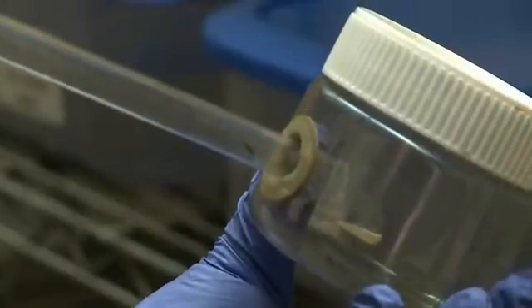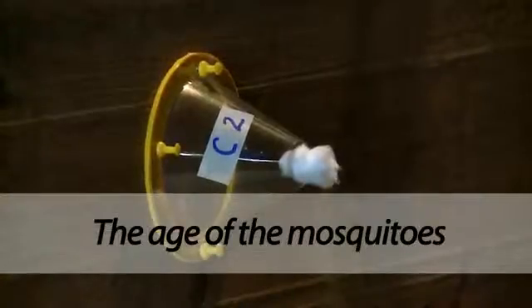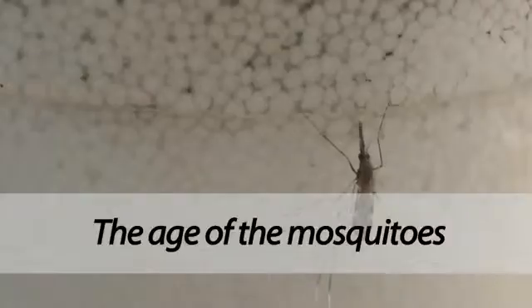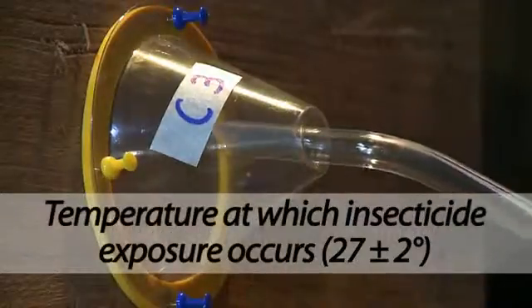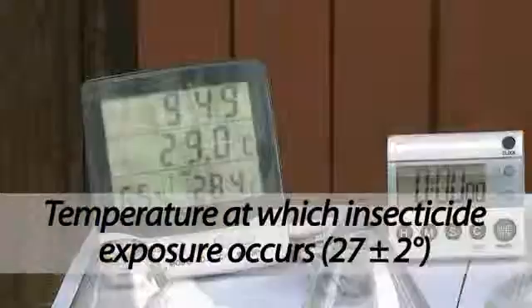When mosquitoes are raised from larvae, it is possible to control their physiological state. Use non-blood fed females 2 to 5 days post-emergence. The temperature at which insecticide exposure occurs should ideally be 27 degrees plus or minus 2 degrees centigrade.